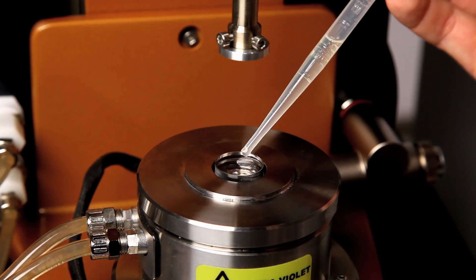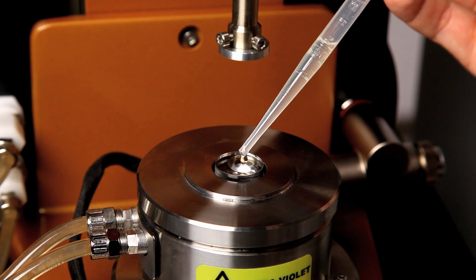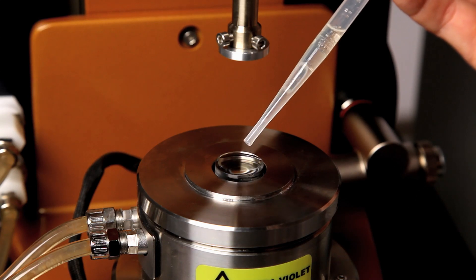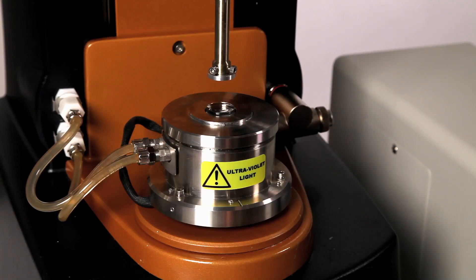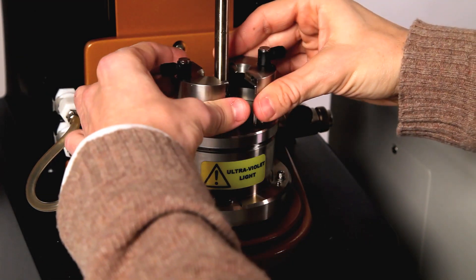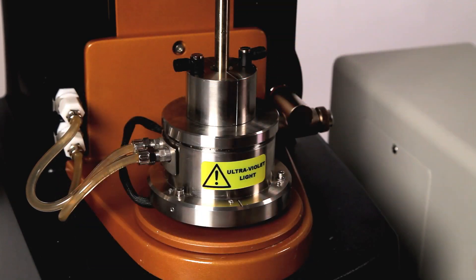This is an optical adhesive that cures with UV light. The typical gap is around 500 microns. After the trimming, cover the sample to avoid the UV photons from natural light which will start curing the sample. Also, remember to protect your eyes from the UV light.